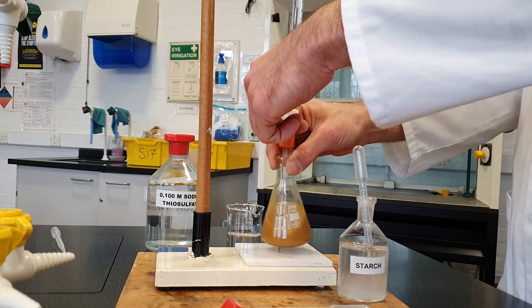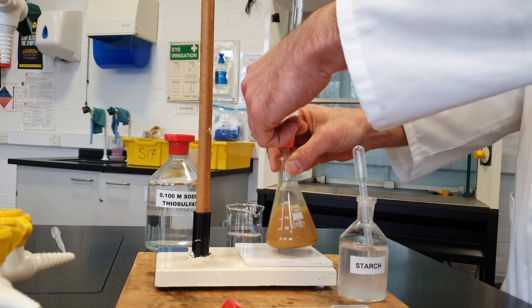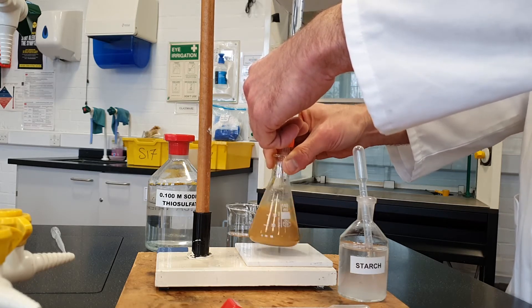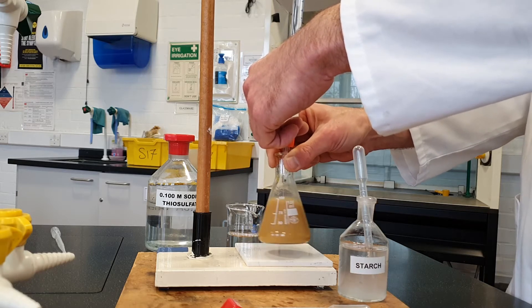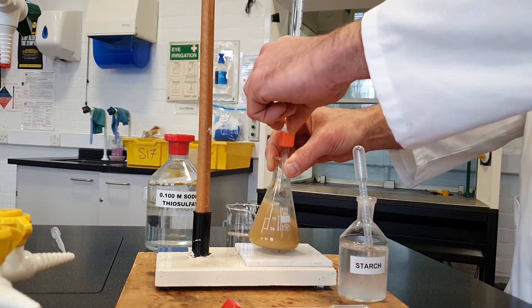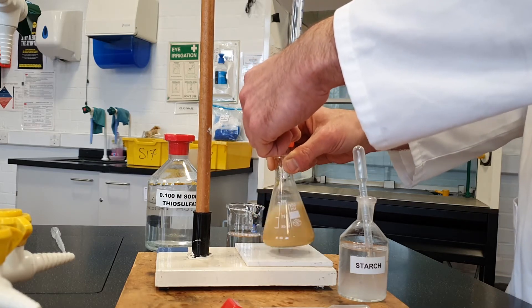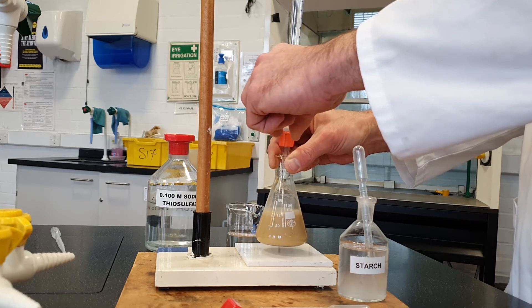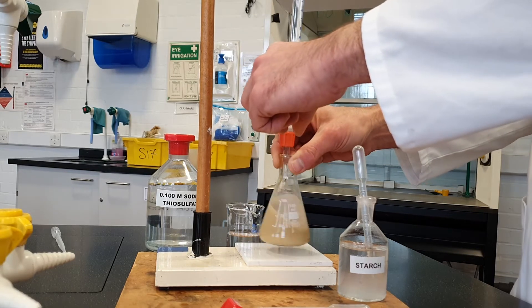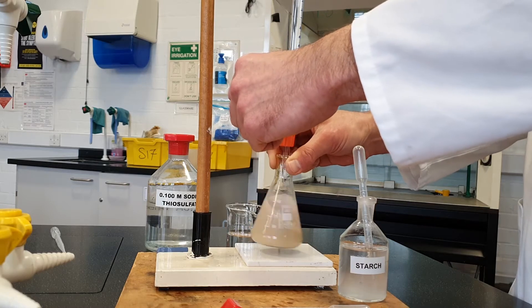Now we're looking for the solution to gradually get paler and paler. As the iodine is reacting with the thiosulfate solution, it loses colour to form iodide ions. It's gradually getting paler. This is where we see how brave we can be — how pale can we get it before we add the starch indicator.